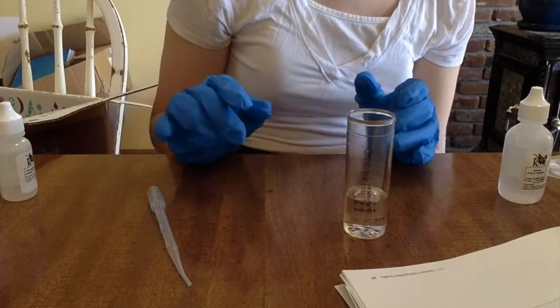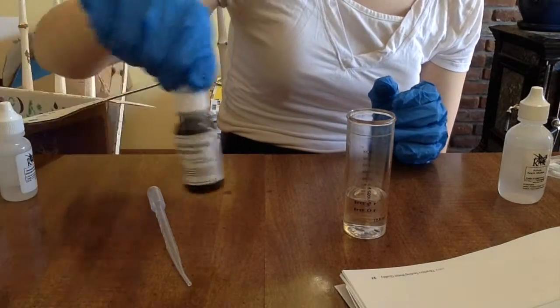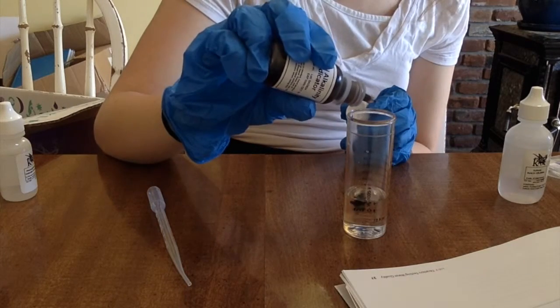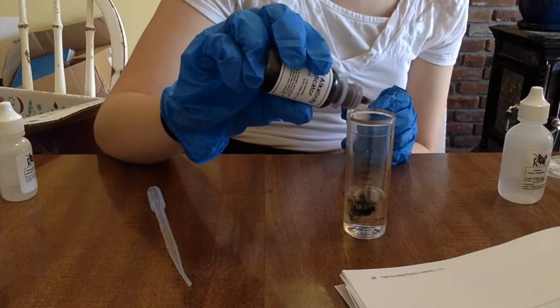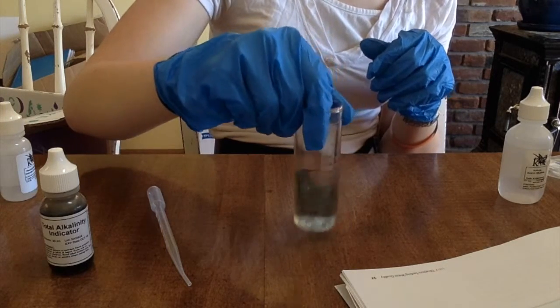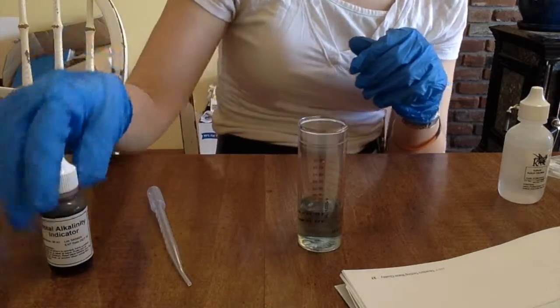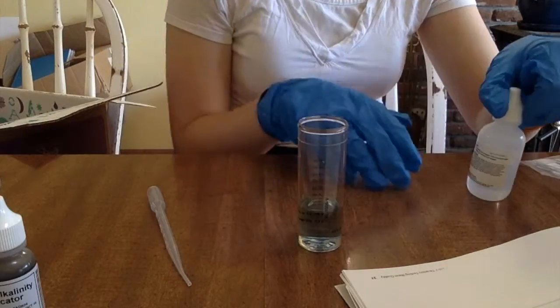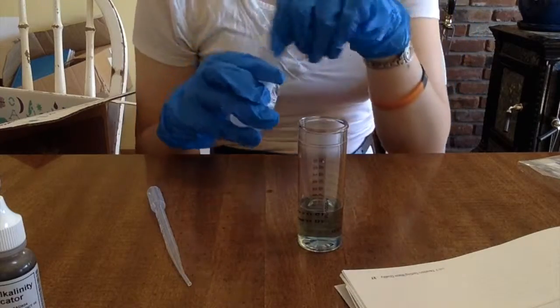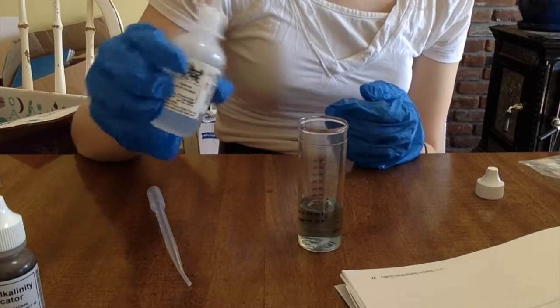Now we need to do three drops of the total alkalinity indicator. It's gonna turn green. Swirl the mix: one, two, three. It's green. It's a pretty nice green. It's about the same as last time. Alkalinity titrant low, which is the same thing as the sulfuric acid. We want it to turn red.